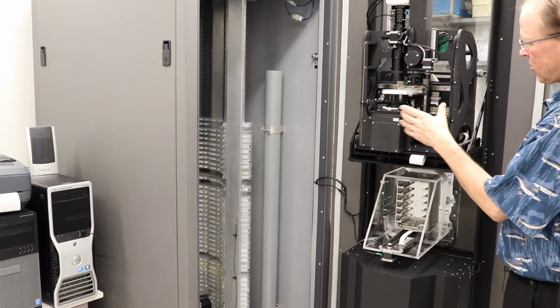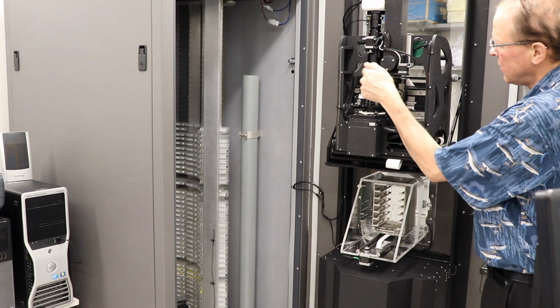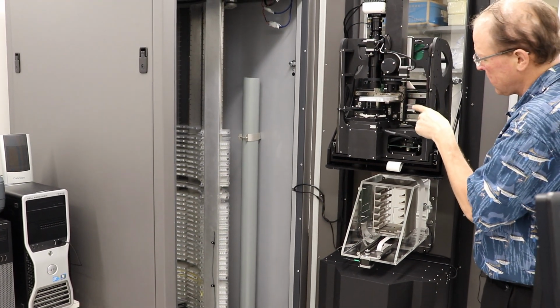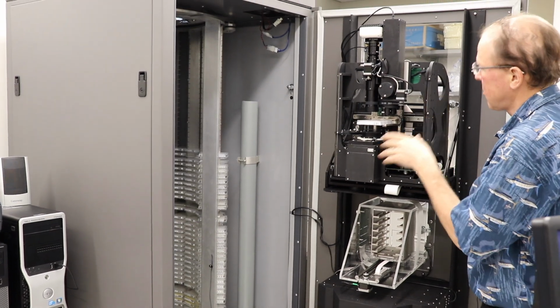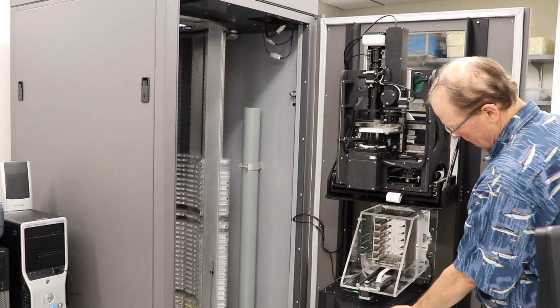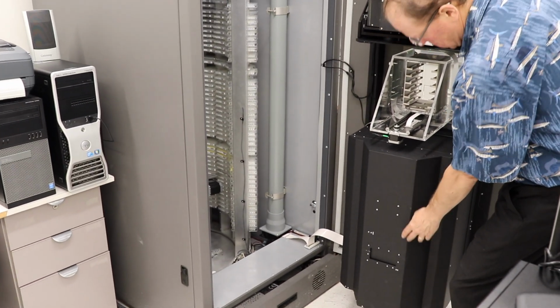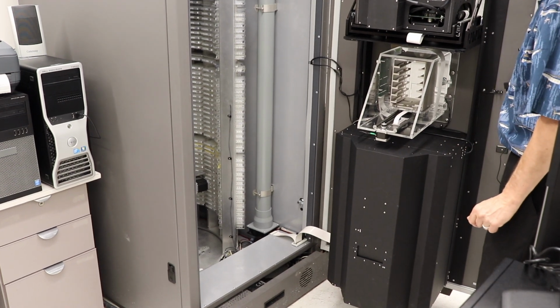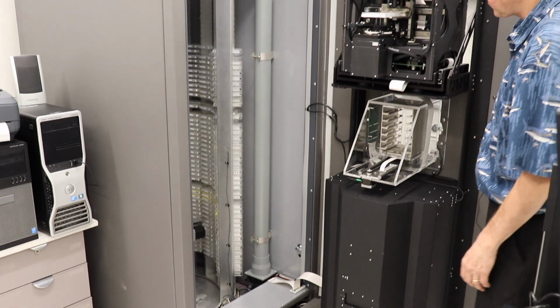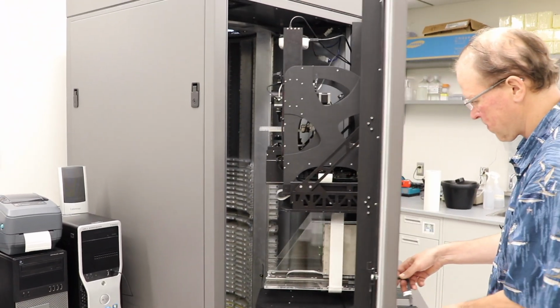This part here is the actual imaging stage. So there's a plate on the stage right now. There's a visible microscope as well as a UV microscope, and robotics that move and center the plate. Down here is the fluorescent module with the door that brings the plates into the fluorescent part of it. And this allows imaging of your experiments.